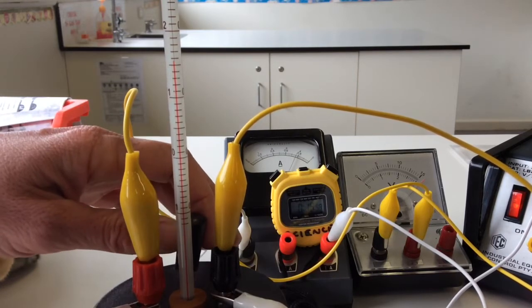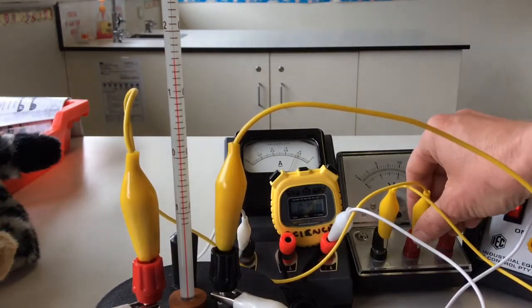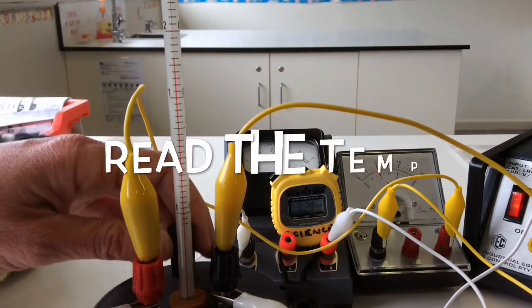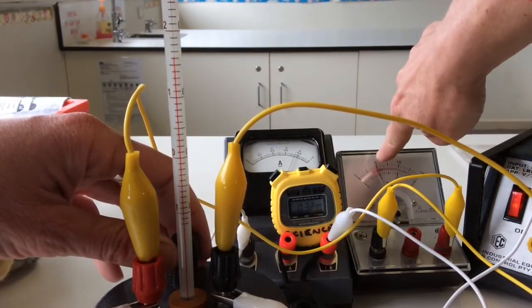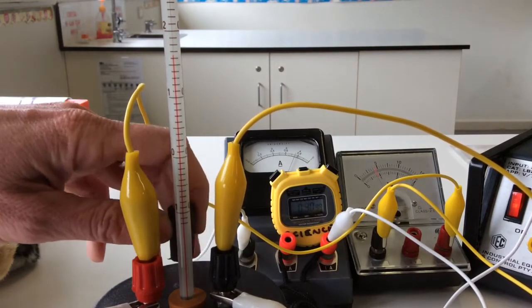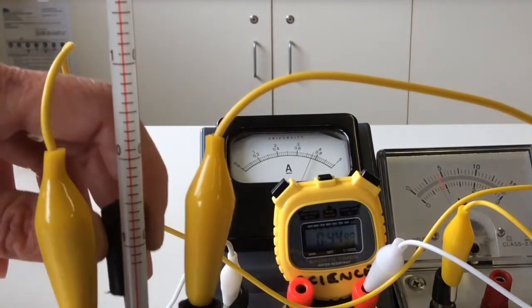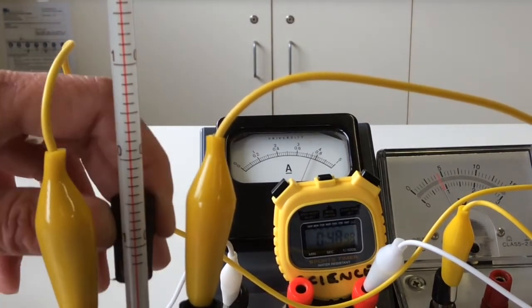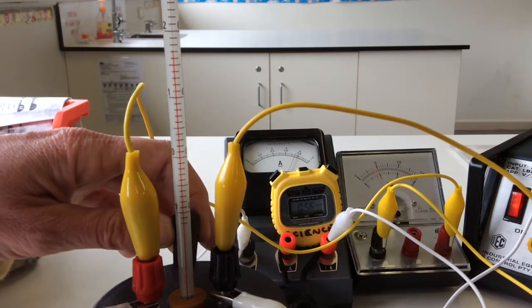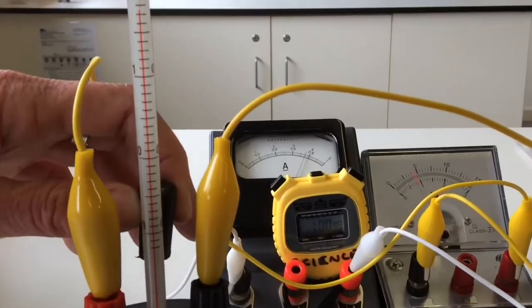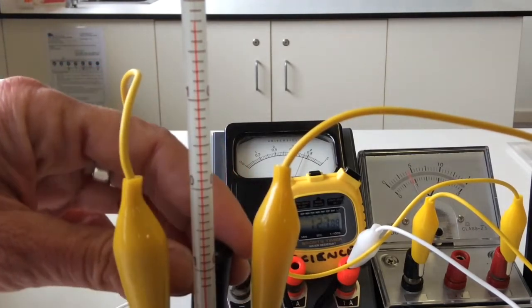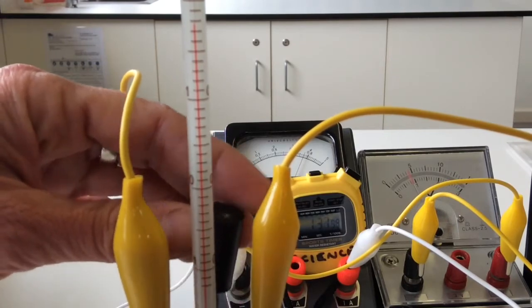It's probably one section under the point eight. And you can see my voltmeter, I'm going to actually have to, I don't know why I put that on three volts, because if we have six coming out of the power pack, as you can see, we don't quite have six. We're reading the top scale. That's five right there. So the red needle, which is really hard to see on the video. Okay, it's just below that five. Okay, 30 seconds is already gone. What's the temp? Another 30 seconds is just gone. We're up to a minute 30.